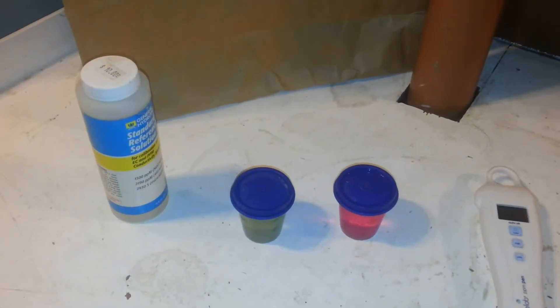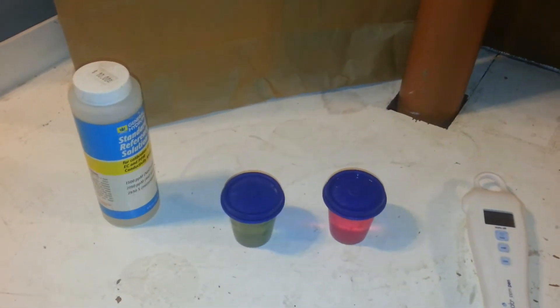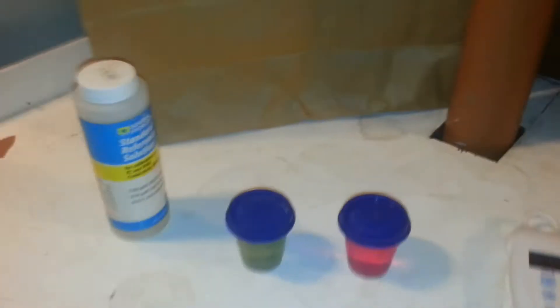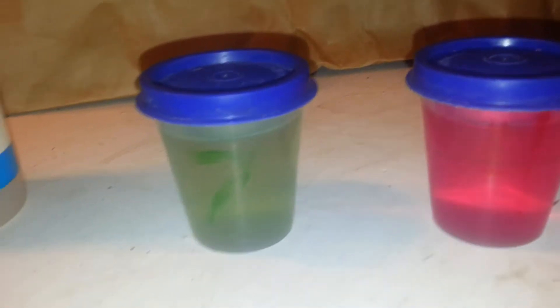Today we'll talk about the proper way to calibrate a PPM and a pH meter. I always tend to get the big jars of 7 and 4 pH and keep them in my safe. Every month I will replace these and do my measurements out of these. This doesn't seem to change or fluctuate whatsoever, so I pretty much store it anywhere, but I usually keep these in the dark.